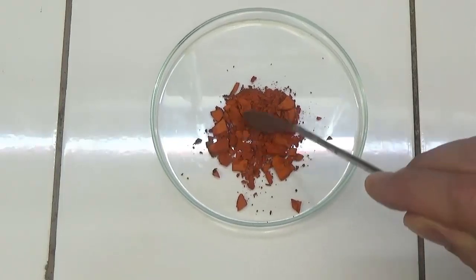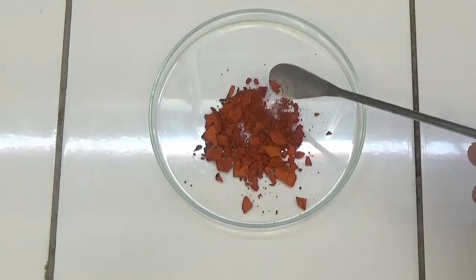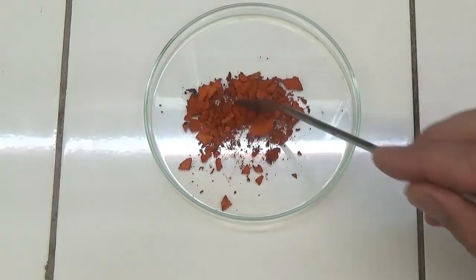Quinizarin, also known as Solvent Orange 86, is an orange to red-brown crystalline powder.